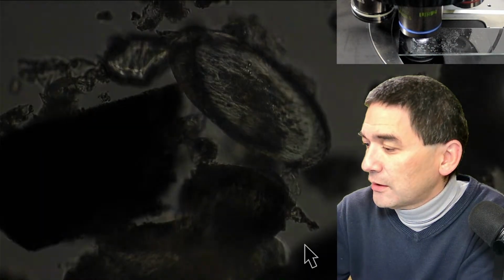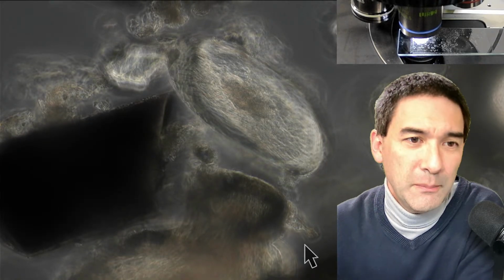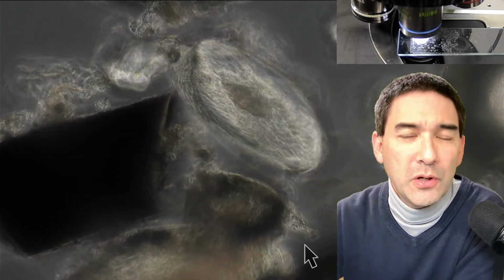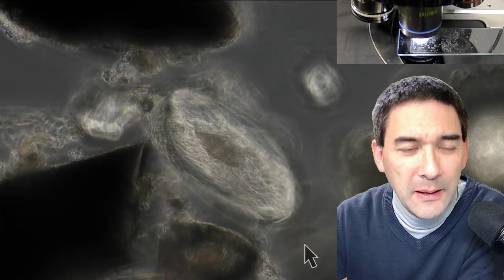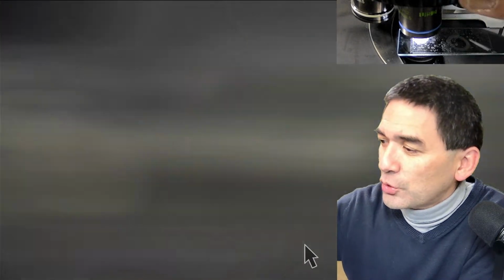That is again a different thing. Yeah, and in phase contrast we see that it doesn't always look very nice, but in phase contrast, this is how it would look, and it's also a very high magnification. I just want to show it to you because those of you who joined a couple of weeks ago when I put some diatoms under the microscope, it really looked nice. But generally, I just want to show you that fairly large and thick specimens do not look very nice under phase contrast.